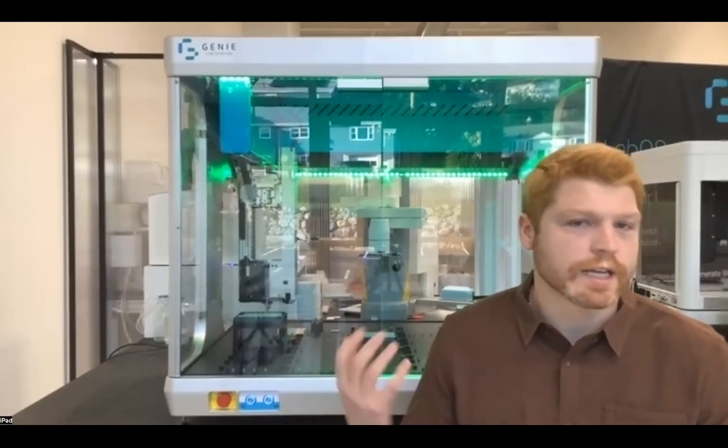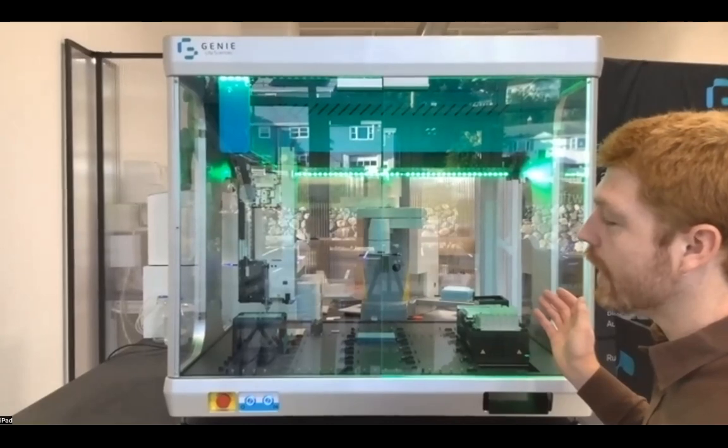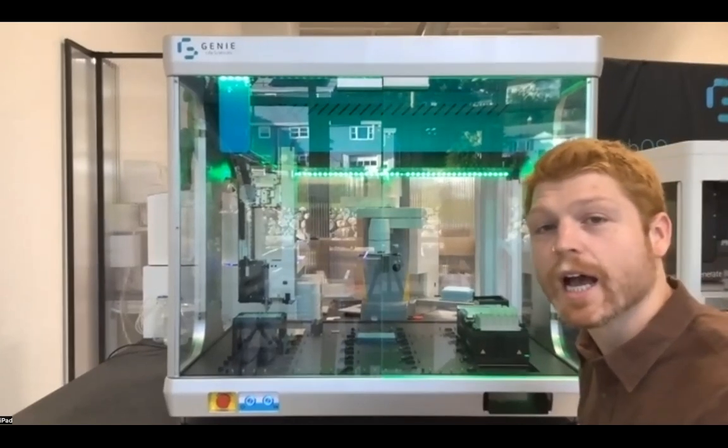And I'm going to start with a very simple explanation and showing of the features for how you'll be able to provide solutions for basic applications such as PCR setup, things of that nature. And then I'm going to move forward in complexity and abstraction from just using the LabMate to using on-deck devices, as you can see here, then moving towards LabMate-centered work cells, which is going to be composed of everything that's currently sitting behind the LabMate.